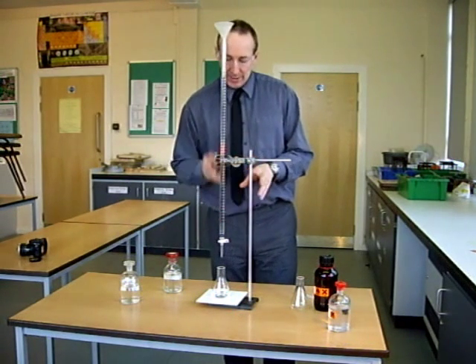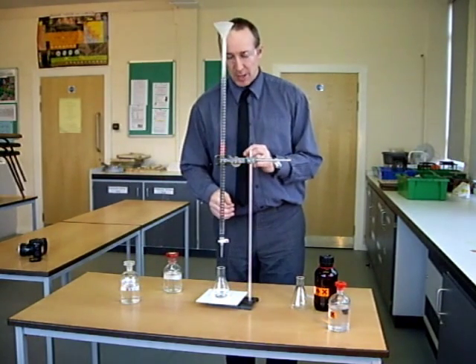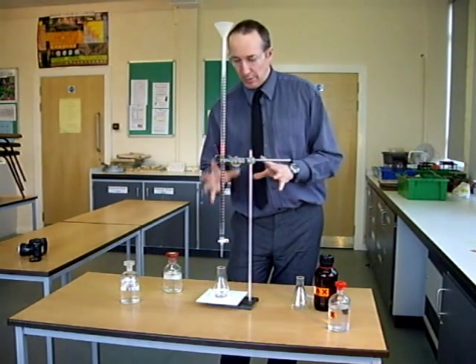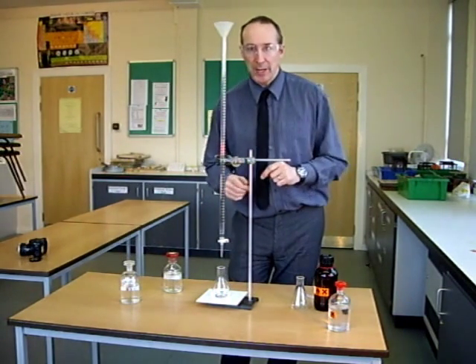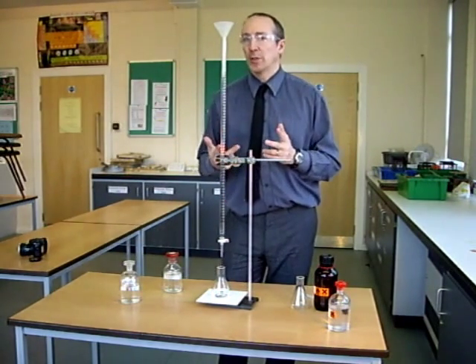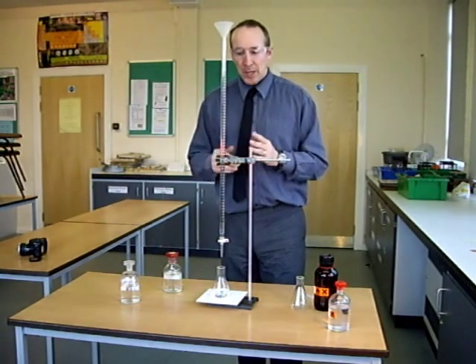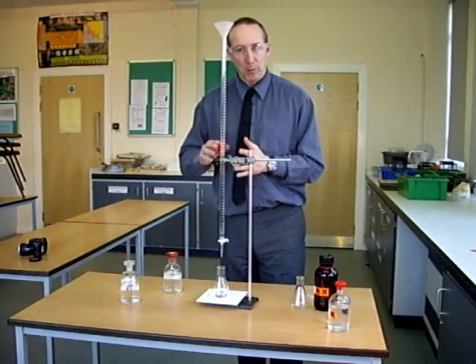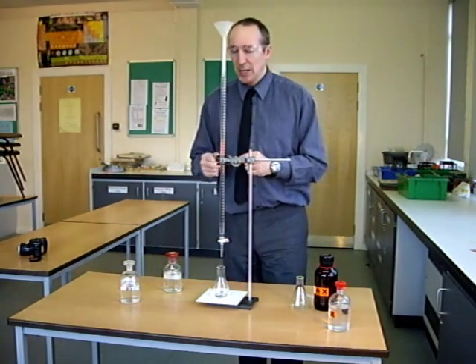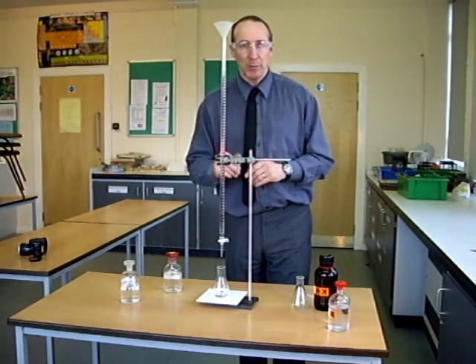I need to repeat that. I've got quite a nice value on there, but I need to repeat it because there may have been something in the flask, some unusual event that I didn't pick up, some contamination or other, and we would normally say you want to get 3 concordant readings. What we mean by that is 3 readings that are very close to each other. If I did it 3 times and one value was a bit away, usually the first one is the least accurate. We call that your test run. But if I did 3 readings and they were all the same, I can keep the first run.